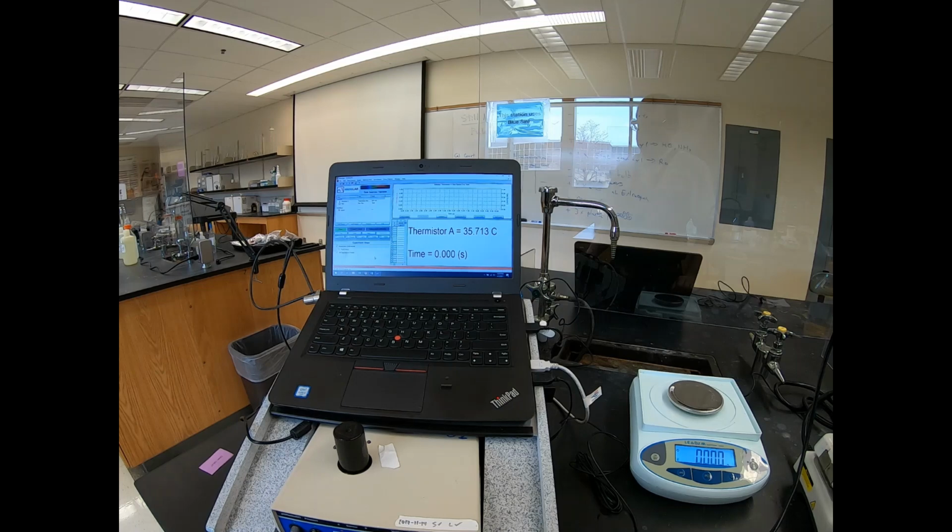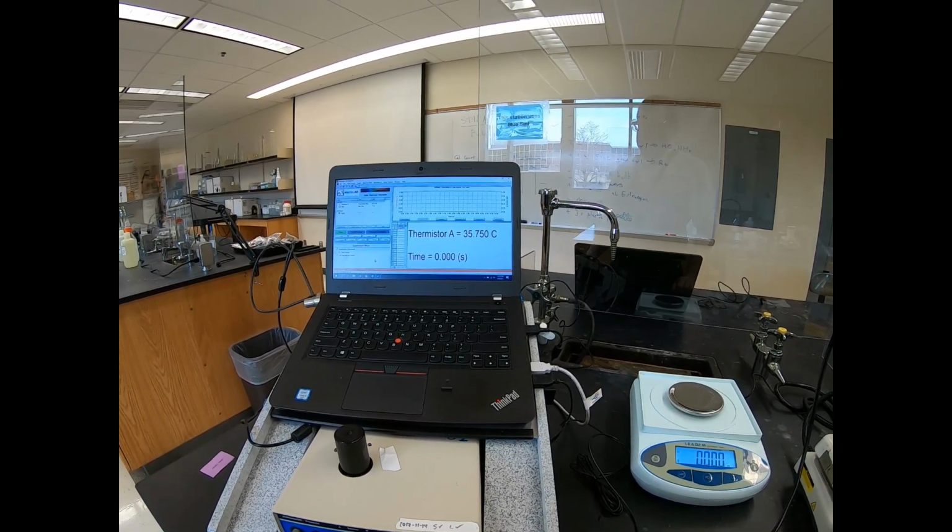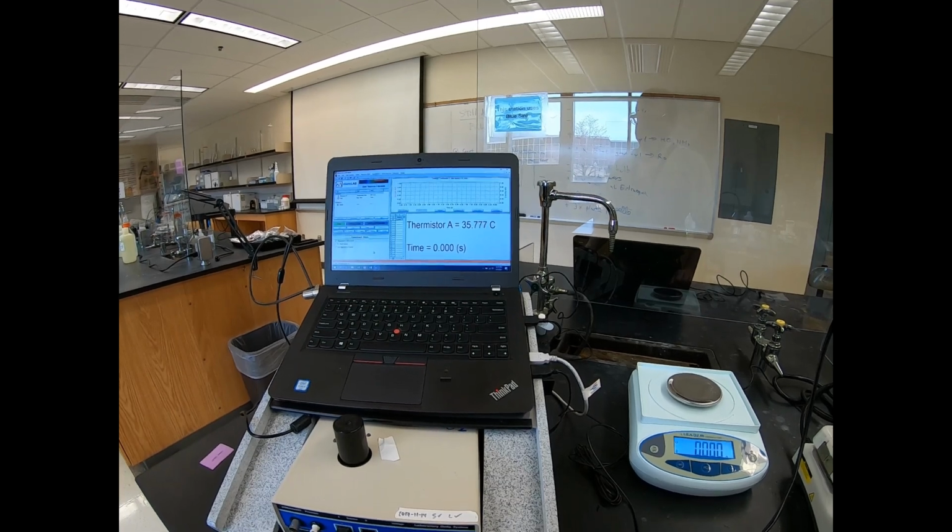Okay, we'll wait for a few extra seconds here. Make sure it's really reached its peak and is headed back down.